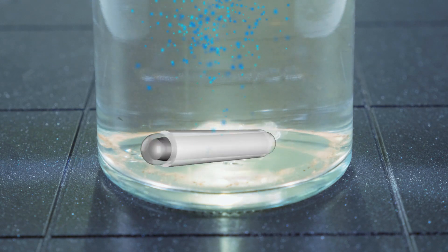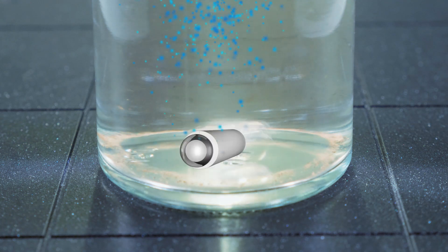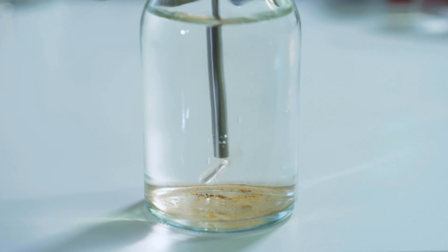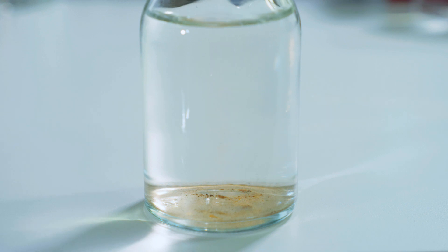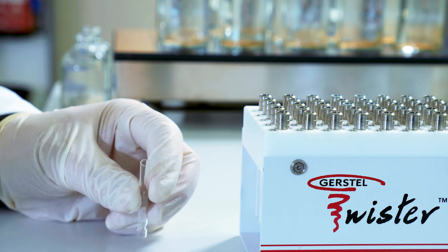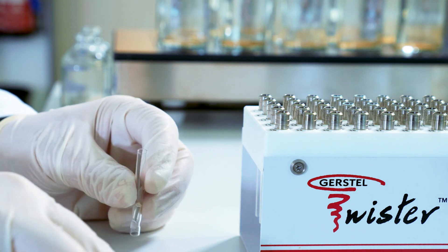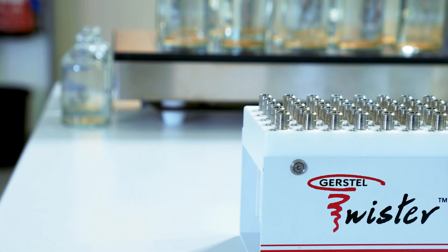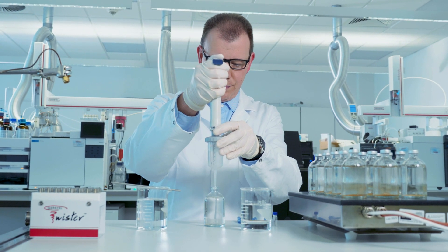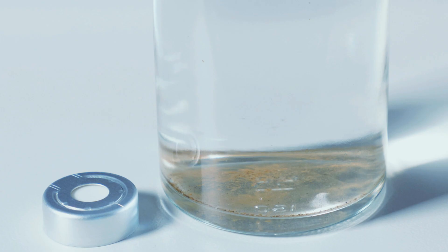During the extraction, analytes are concentrated in the sorbent layer on the Twister. The analyst removes the Twister from the sample, dries it, and places it in a glass tube. The tubes are stored in individually sealed tray positions for analysis, which eliminates contamination or loss of analyte.